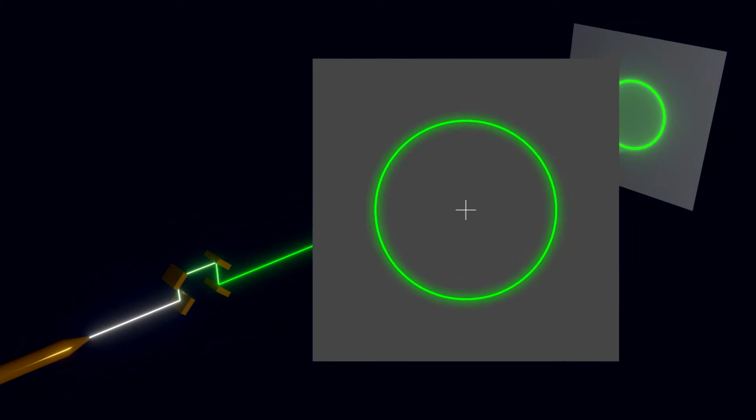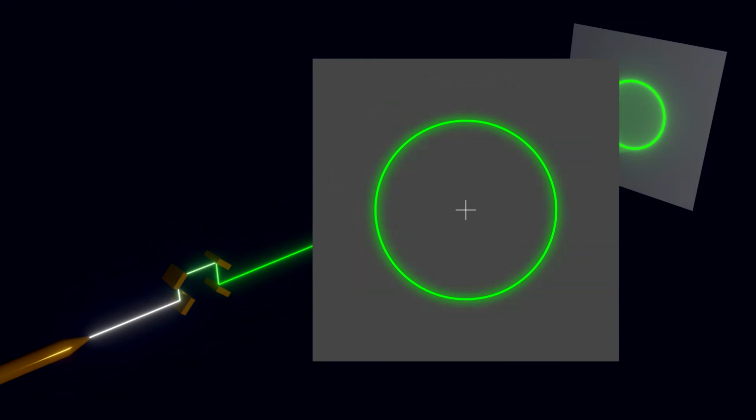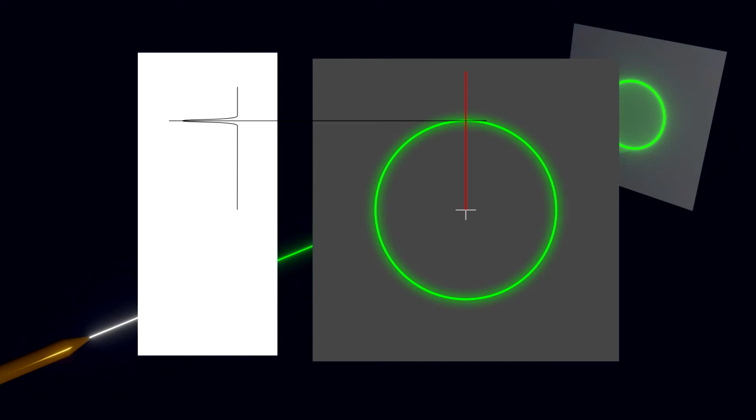On the detector plate we get sharp concentric rings, one for each diffraction peak. For clarity, let's just look at a single peak for now. We can convert the 2D image to a 1D diffraction pattern by drawing a line from the center out and plotting the intensity as a function of the angle from the center. The resulting peak has a perfectly symmetric shape. We can draw cross-sections in all other directions as well and sum up the profiles to improve the signal-to-noise ratio. This way we obtain a one-dimensional diffraction pattern with extremely high signal-to-noise ratio.